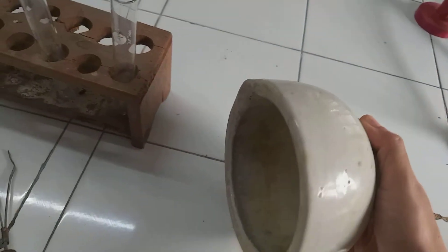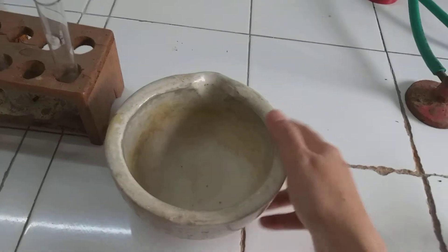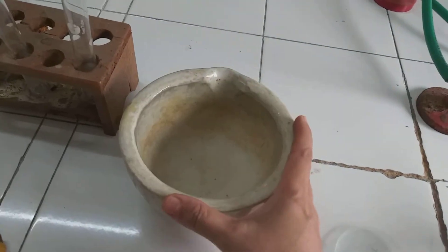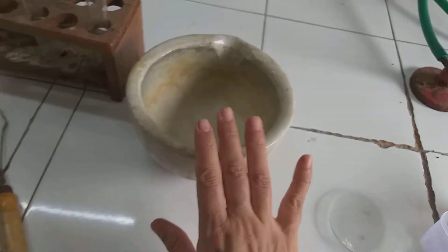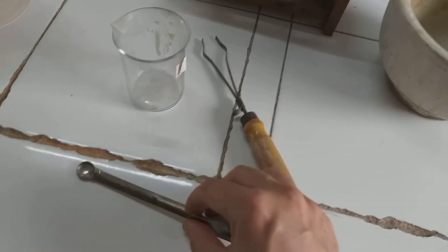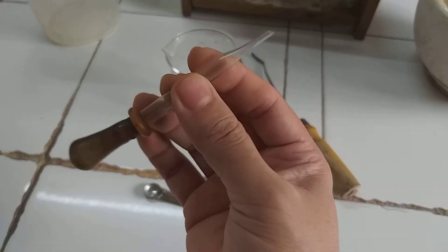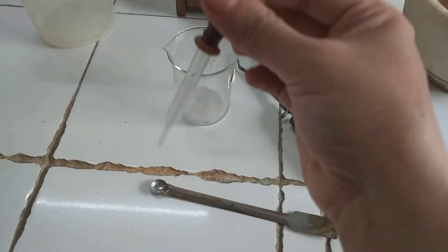This is called a mortar. Its pestle is not here — I will show it to you later. We use it for grinding. This is something people have in their houses also. This is called a spatula, used for taking out various substances.